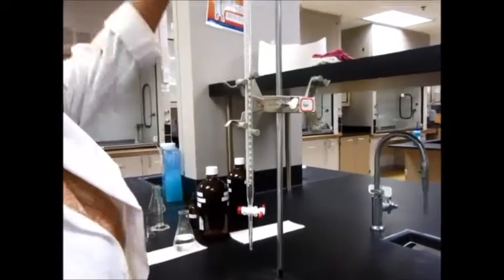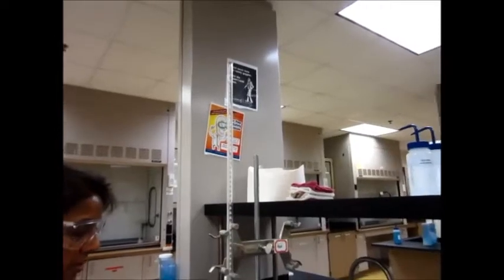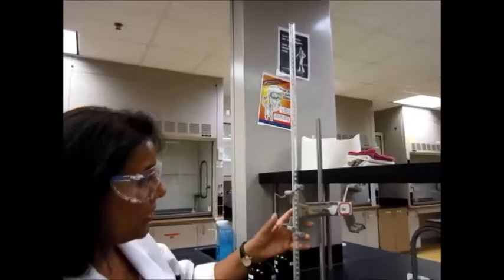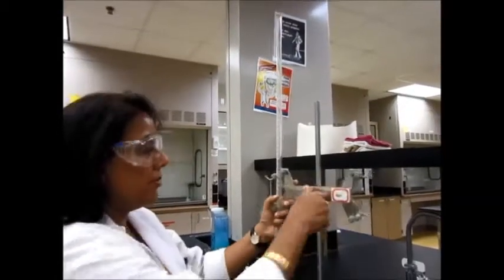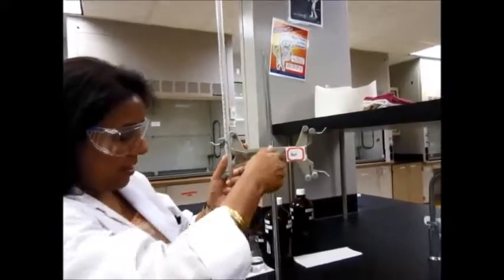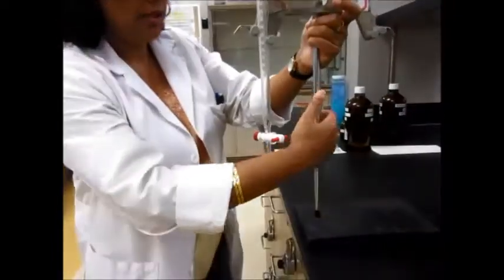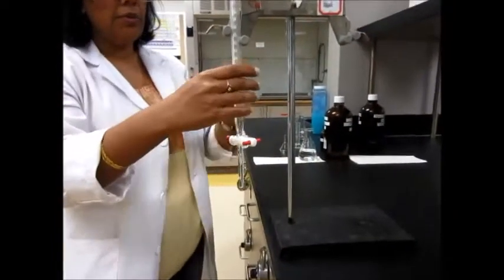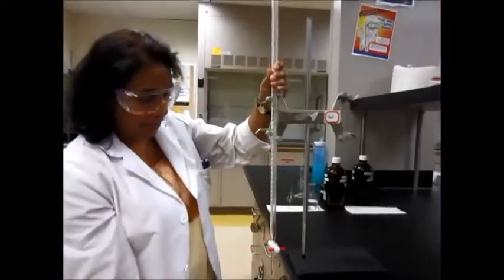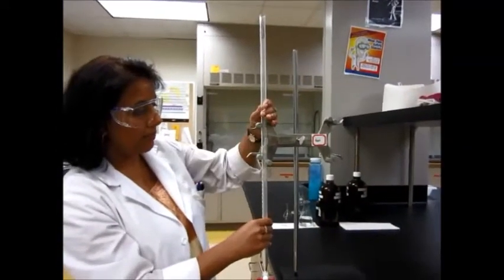In order to fill a burette, you need to fill it from the top. For a person who is a little bit vertically challenged, this is not the easiest thing to do. So in these cases, what you may need to do is turn the burette around so it's facing the other side of the stand and push it out on the edge. Be very careful that you don't break the burette and don't let it slip down. So be very careful, and then place your burette here.